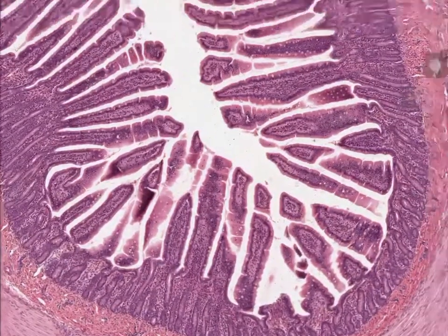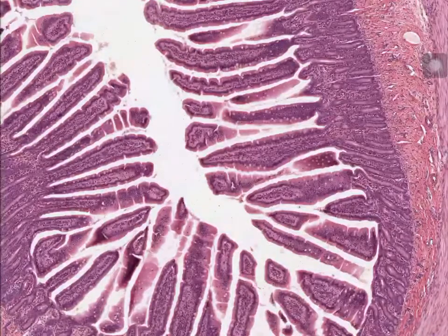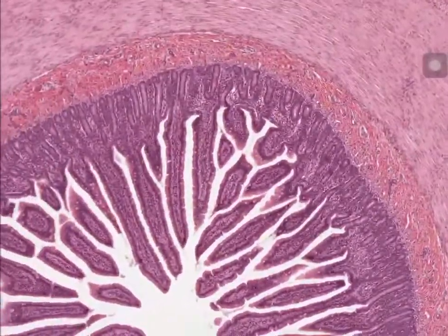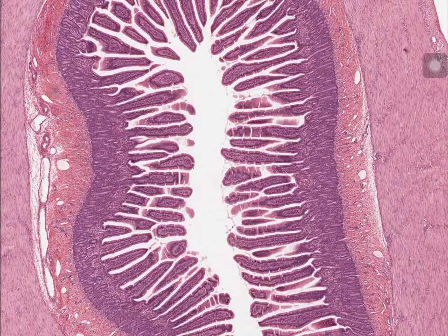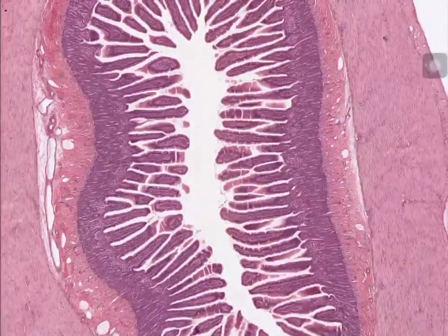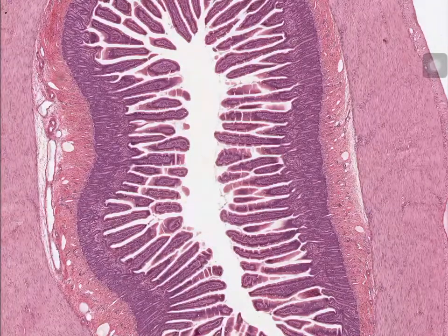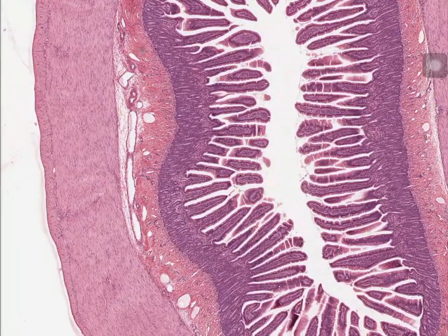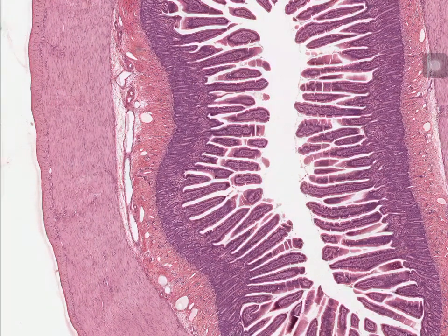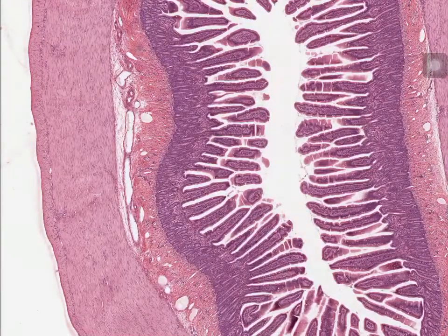So now let's go ahead and put that down as one of the features. One feature of this part of the small intestine is that it doesn't have any of the special submucosal features, right? It's kind of bland in there, okay? So the only portion of the small intestine that does not have any of the features, such as the Brunner's glands or the Peyer's patches, has to be the jejunum, okay? Now, another thing that you can kind of tell from it, however, this one is kind of to each their own, if you may.